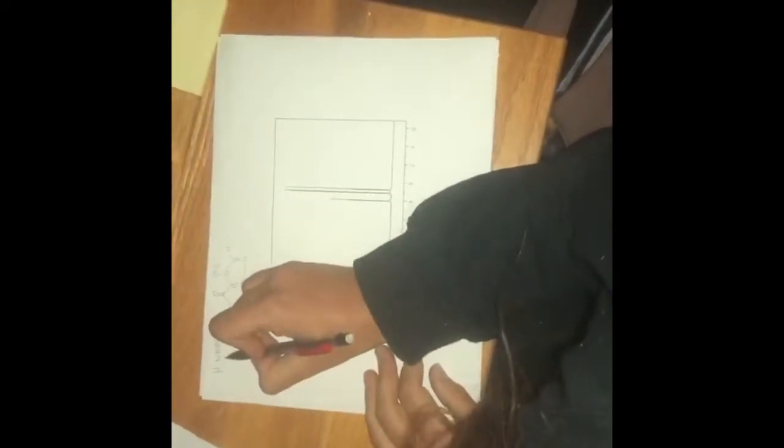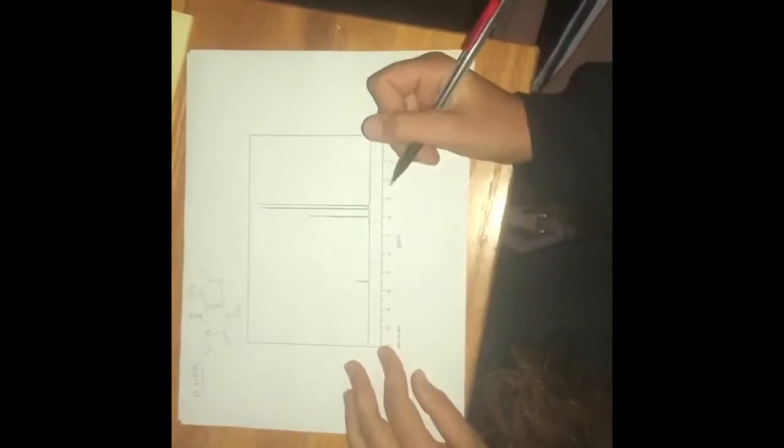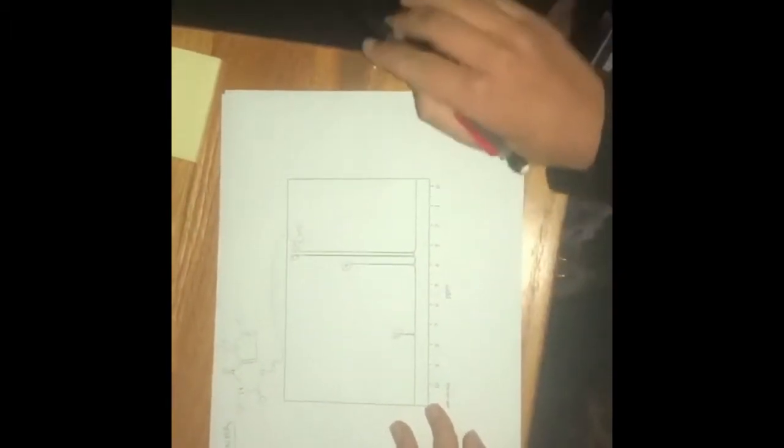So this is called proton NMR, and so with these peaks right here, they all represent hydrogens. So we're going to label them 1, 2, 3, and 4. So this first peak is 3.395, and this matches up with this region of hydrogens right here. And these are the least deshielded because they're the farthest this way. So that means they're not deshielded as much as the other ones.